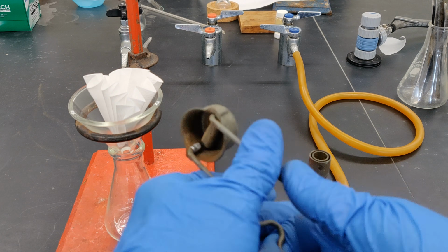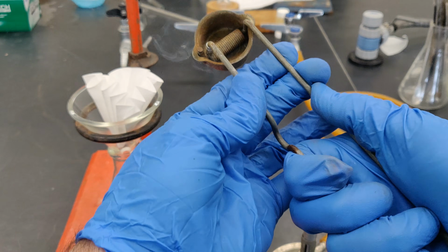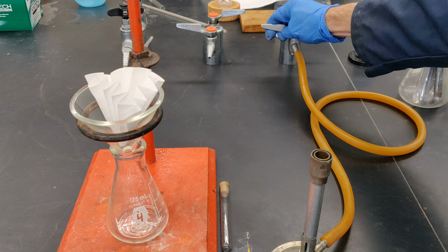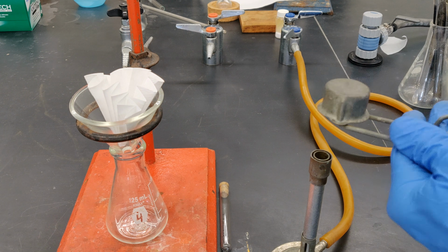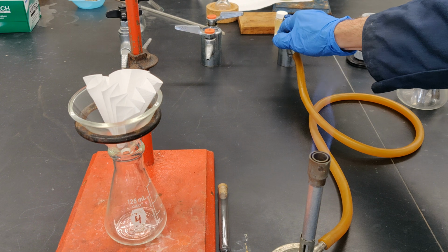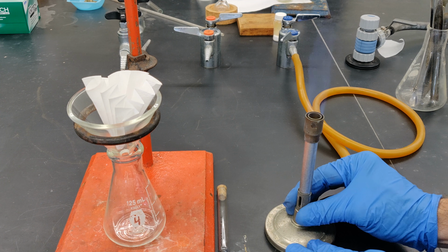You will use the spark from a striker to light the flame. Be sure the striker contains a flint and test it by applying pressure to the flint as you force it across the rough metal of the striker's file. Partially open the tap to admit a moderate flow of gas to the burner, then use the striker to generate a spark directly over the opening at the top of the burner. Adjust the flame height by regulating the flow of gas from the tap. Now slightly open the burner intake window to obtain a more blue and hotter flame.